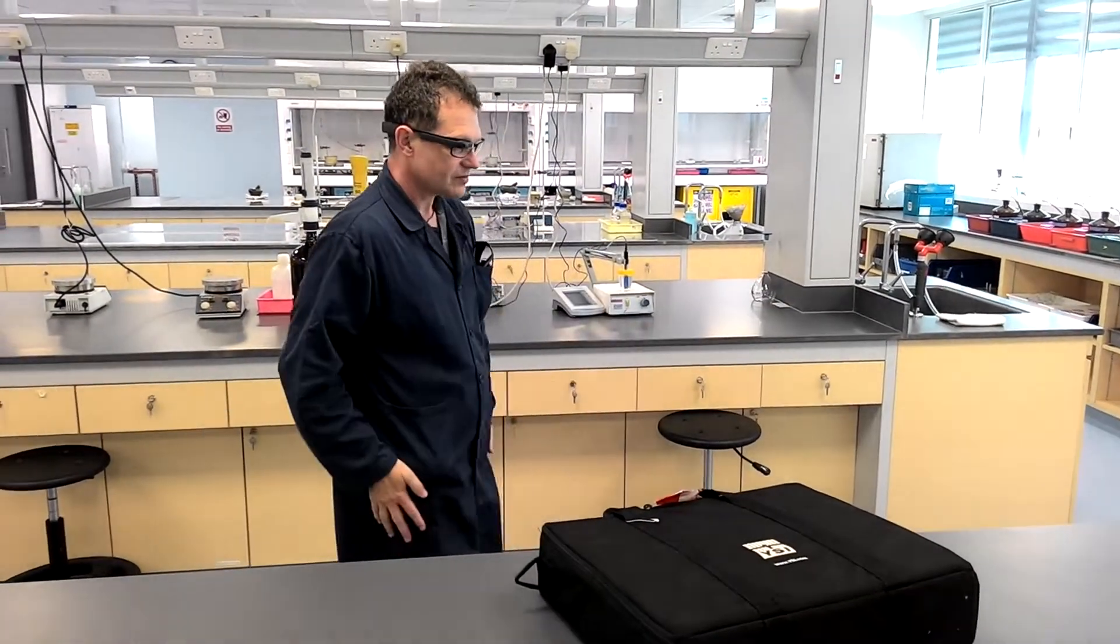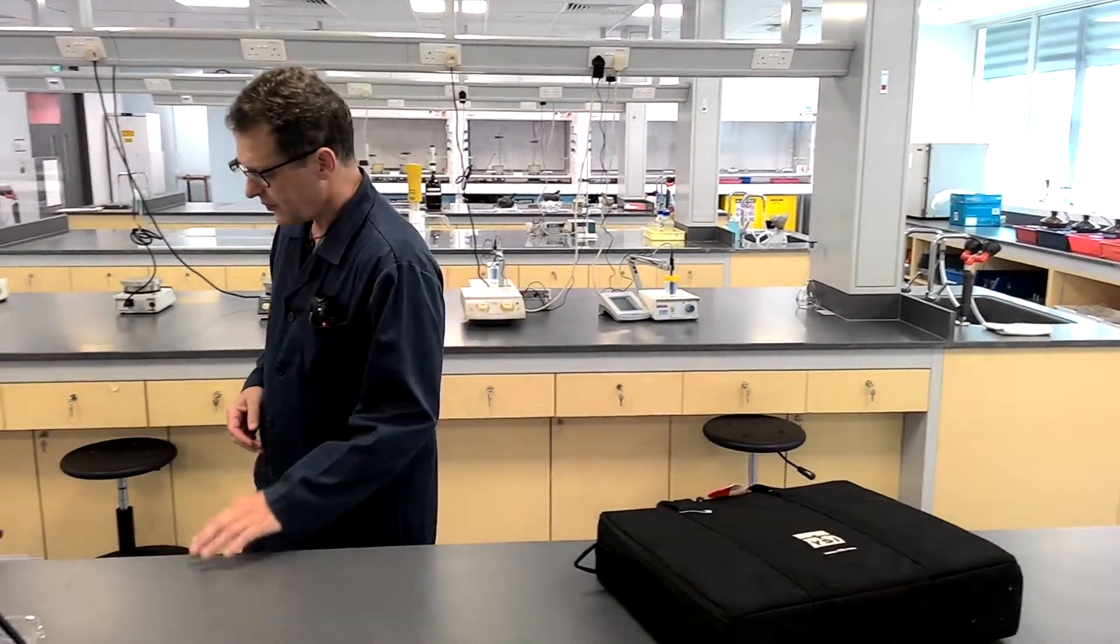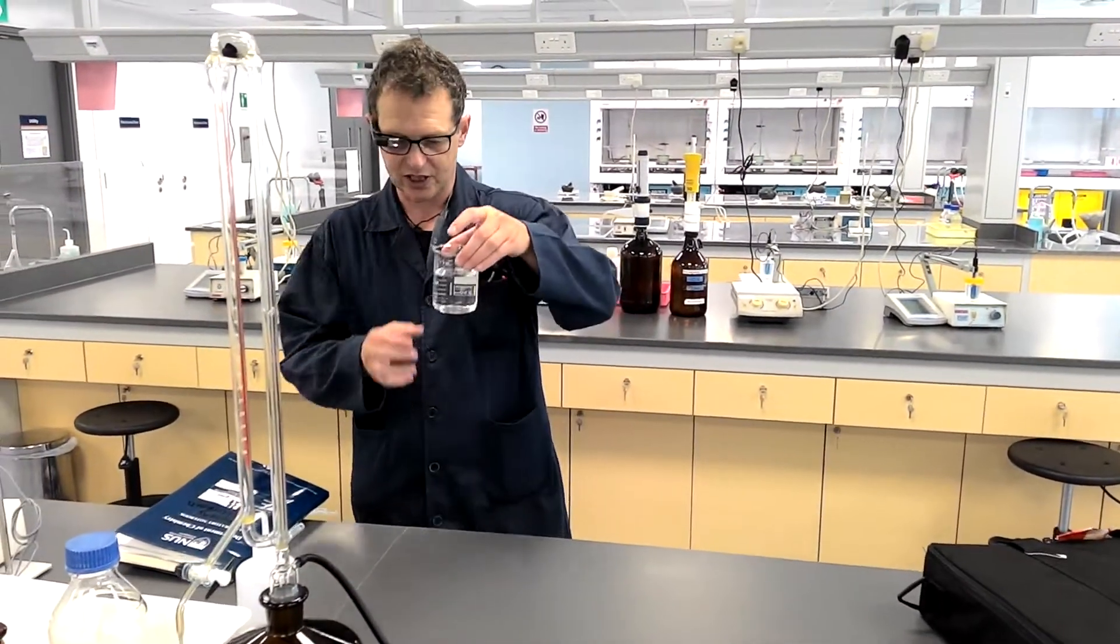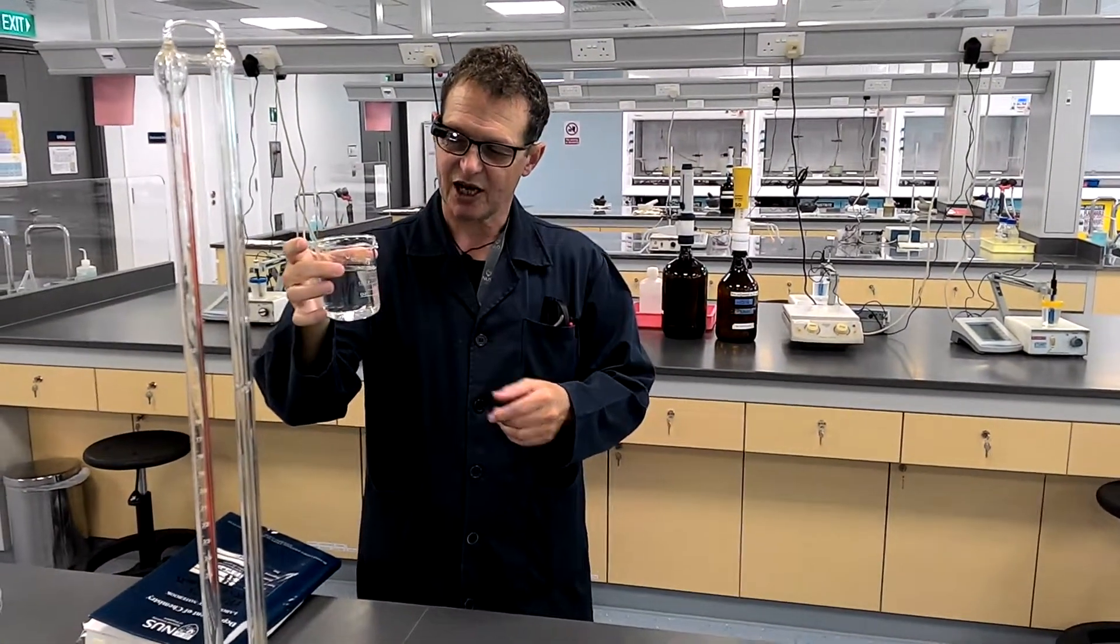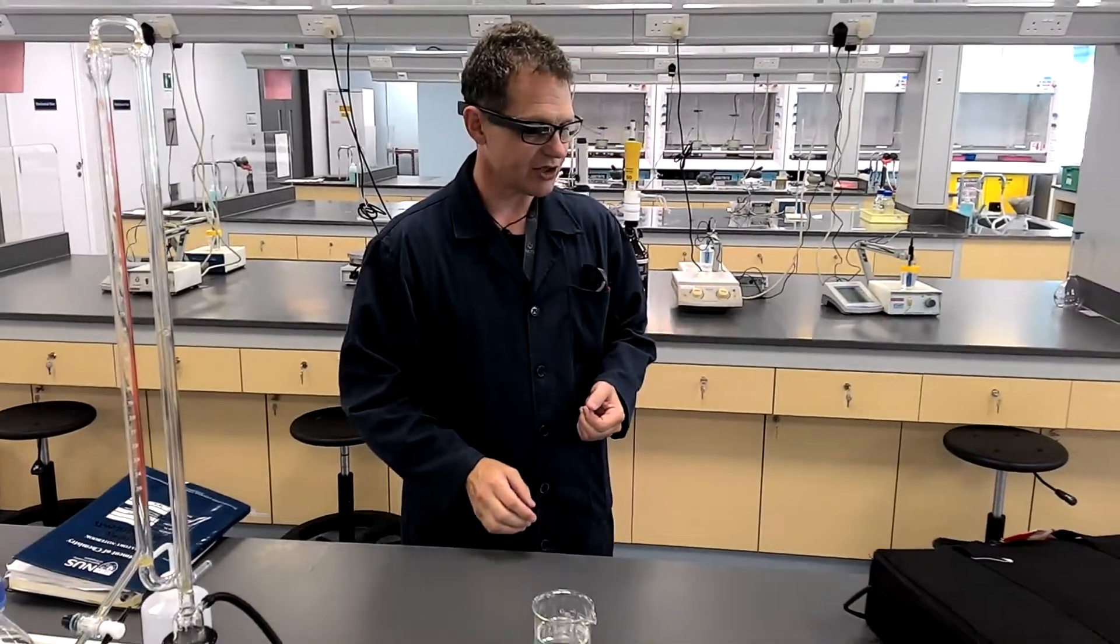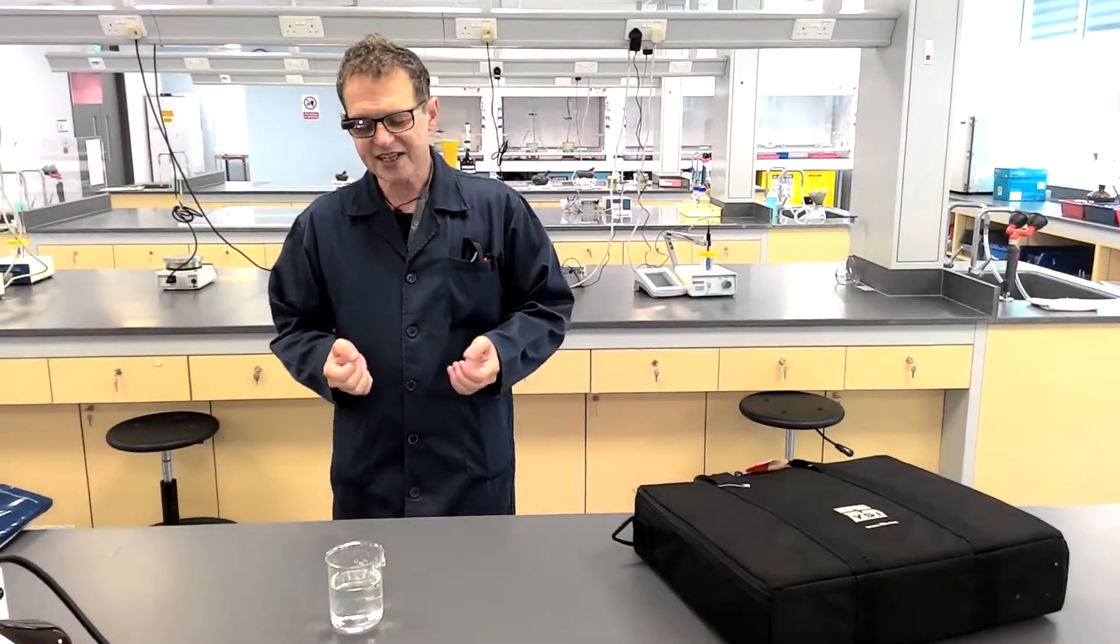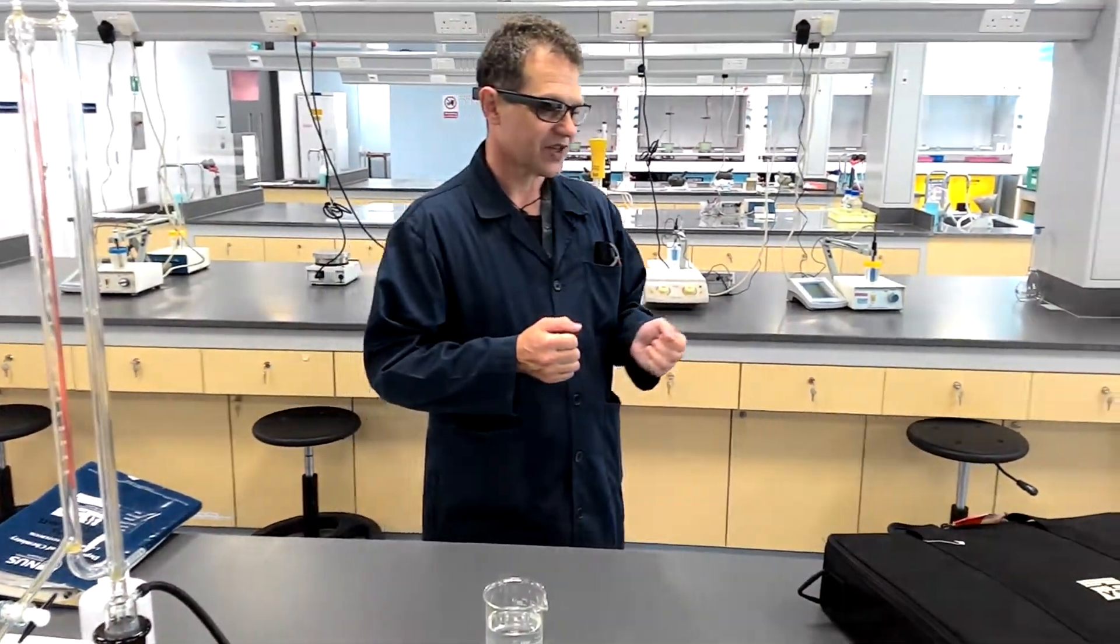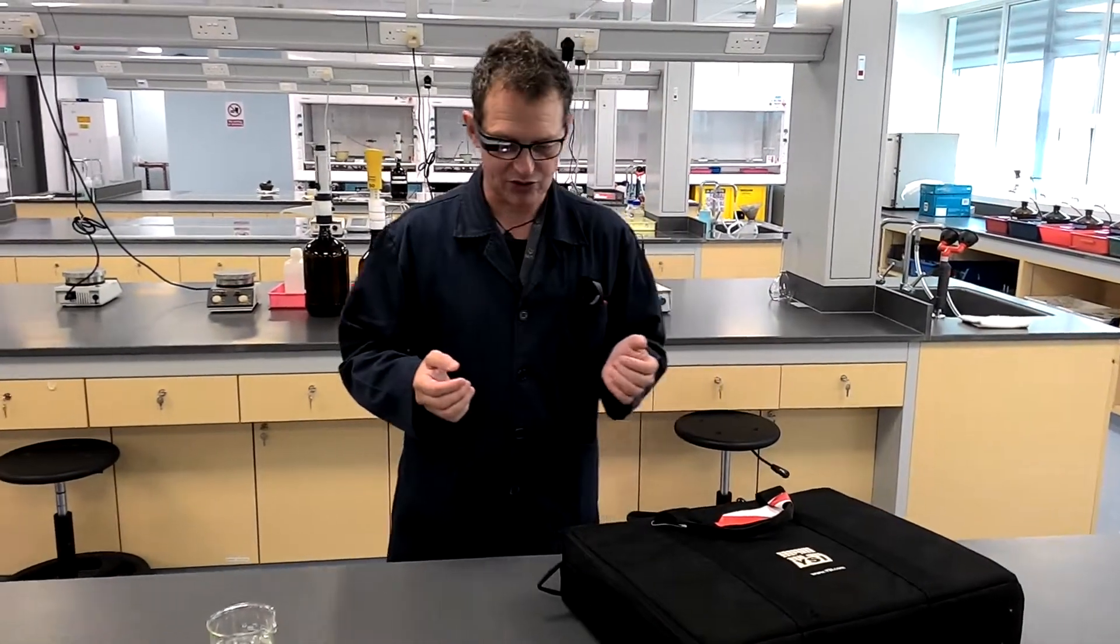So, this is how this works. What we're going to do is take a sample of water, not the sample we took from the river, this is just a tap water sample, and I'll take you through the dissolved oxygen kit. Obviously there are different models of these instruments, some large, some small, but they usually have the same sort of components.